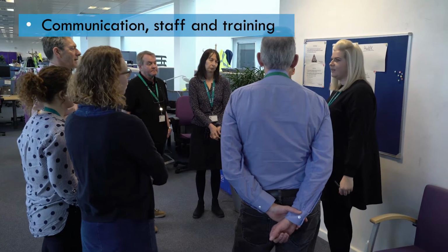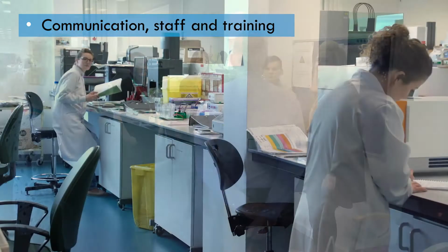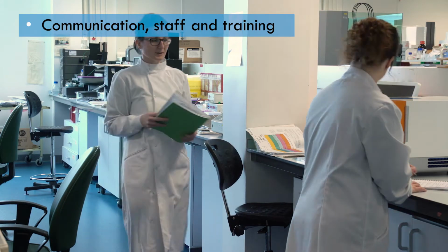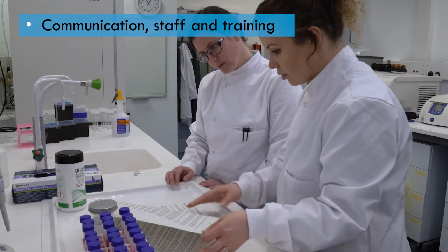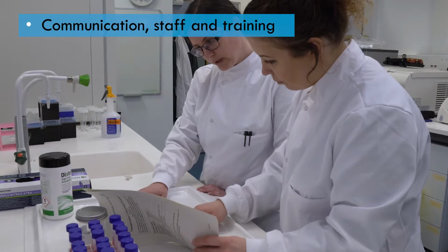Good communications and sufficient numbers of well-trained staff are important factors at every stage of the process, from design and planning through to delivering results. If these important provisions are not properly implemented, it's difficult to work safely and produce reliable results.